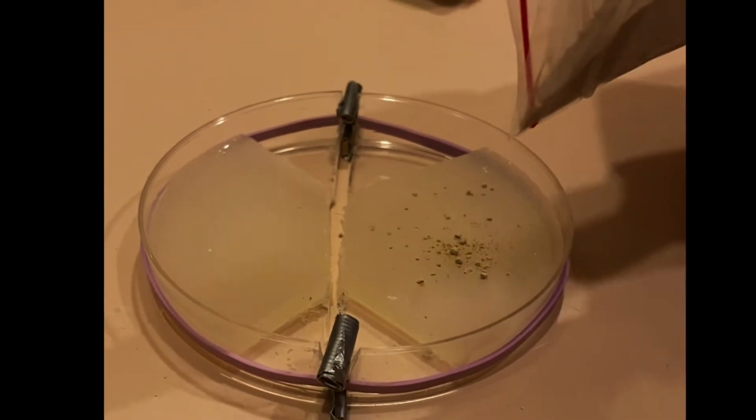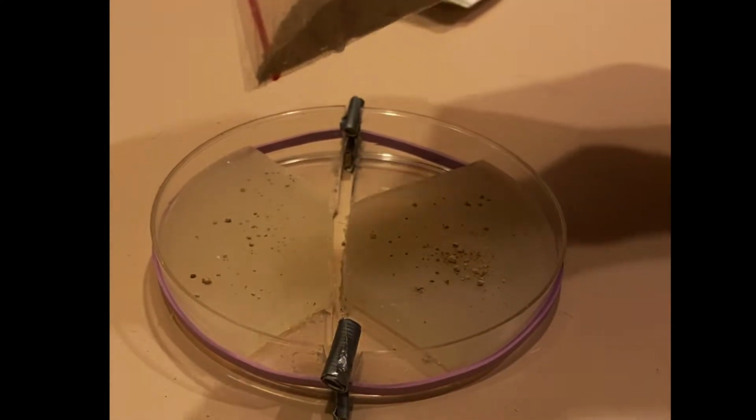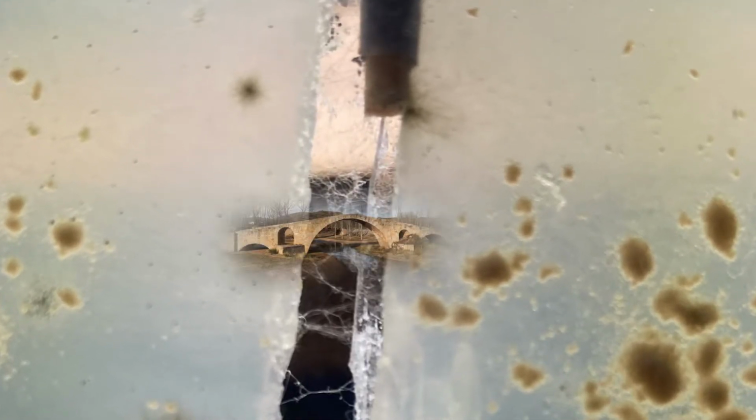Done properly, the only way a signal can pass from one side of the plate to the other is if a conducting material bridges this gap. That is where the mycelium come into play. The agar acts as a growth medium for this mycelium. Given ideal growth conditions, the mycelium will not only grow on the agar islands, but will actually grow across the gap to the other side of the island, and voila, we have our bridge.